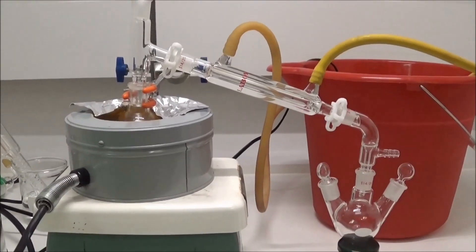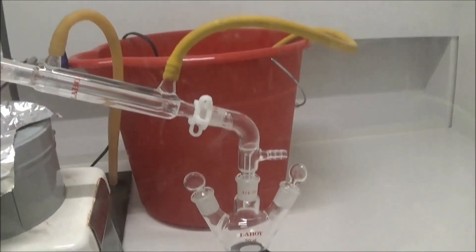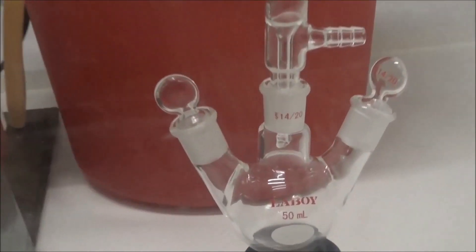I set the flask up for simple distillation to recover the bromobutane. The mixture was distilled until no more oily and cloudy drops came over.